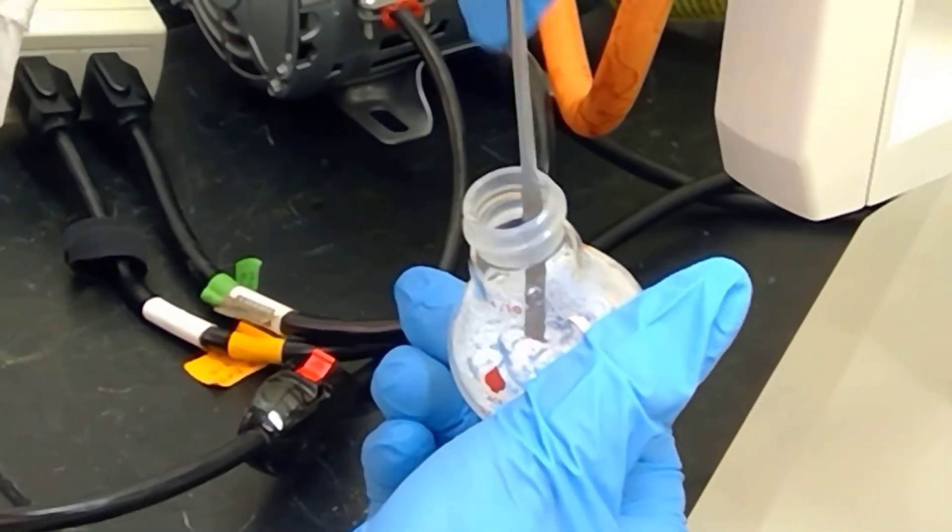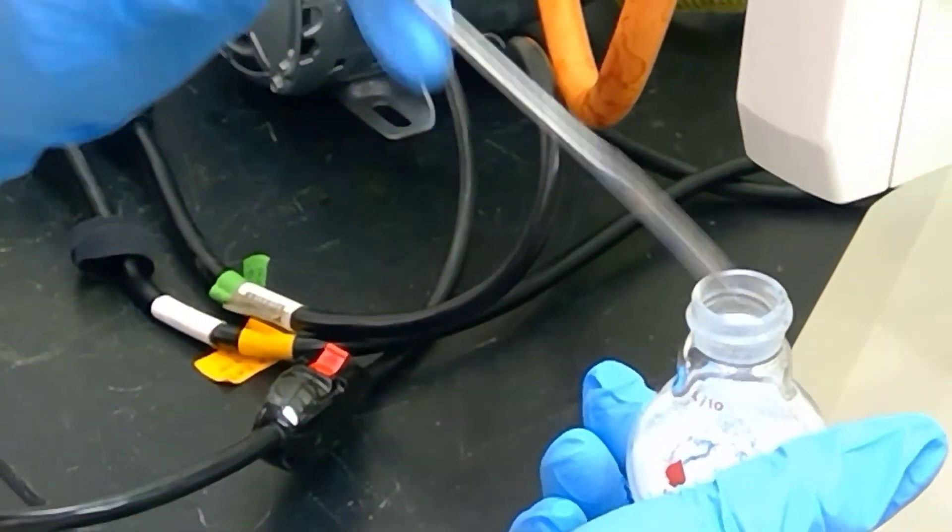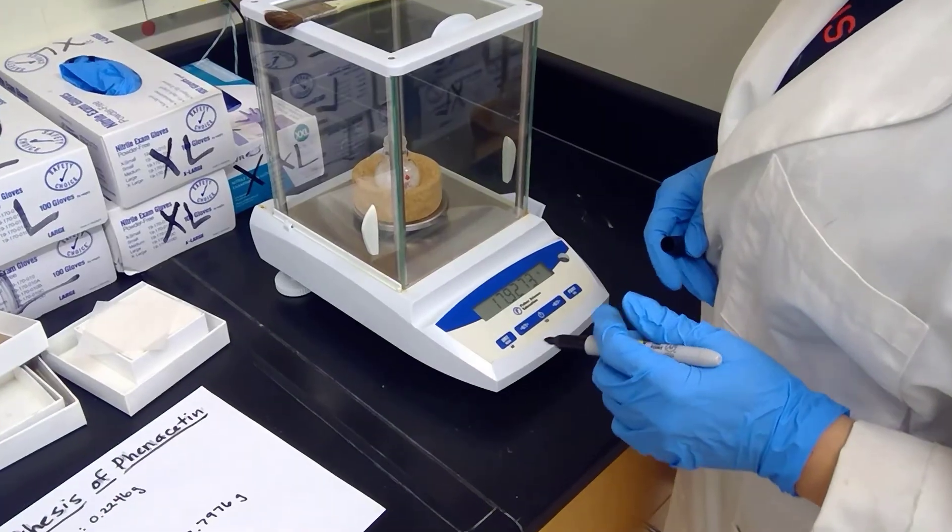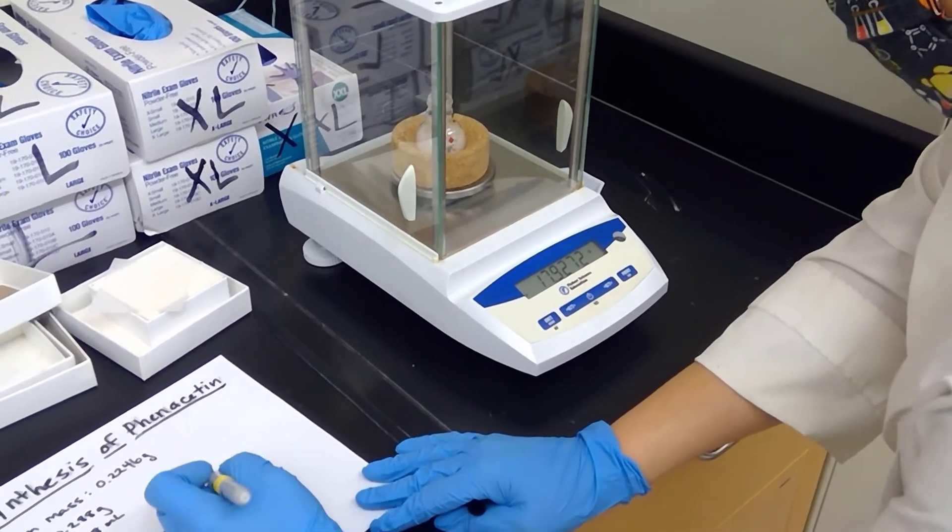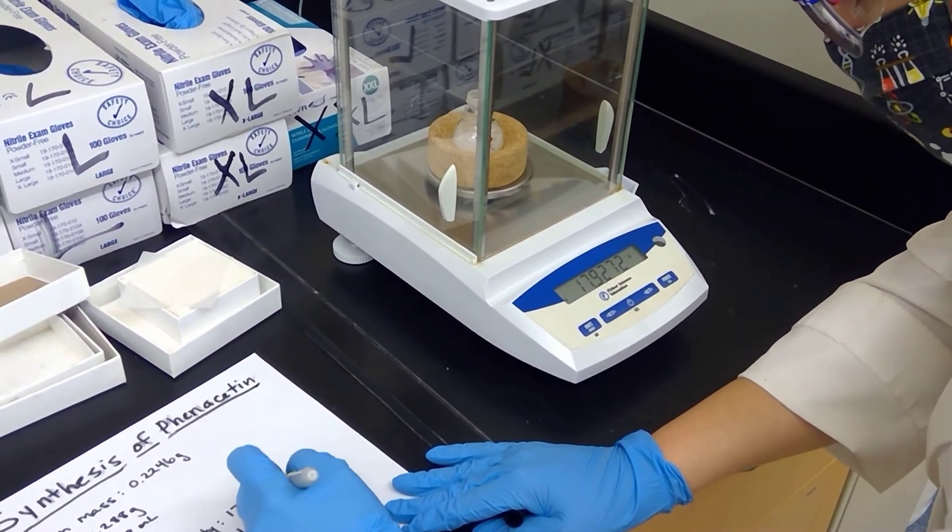We're going to take this over to the scale and weigh it so we can determine our crude mass. This is wonderful - we have a mass of 17.9271 grams.